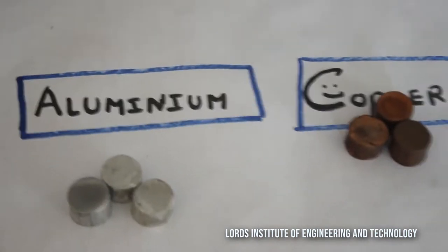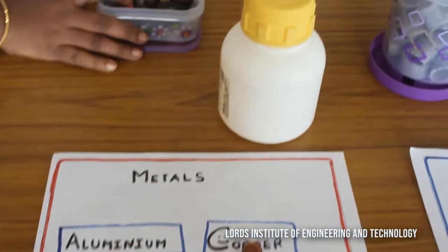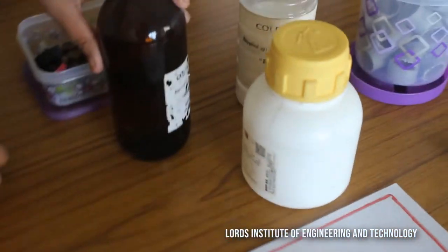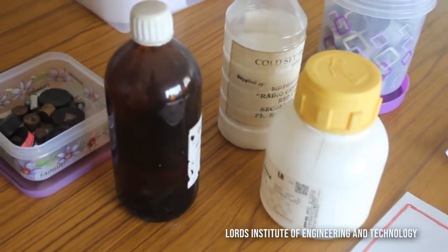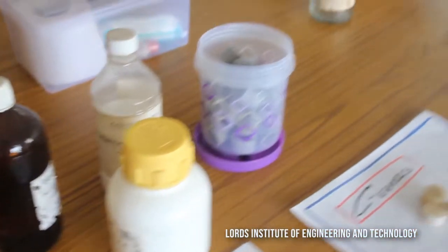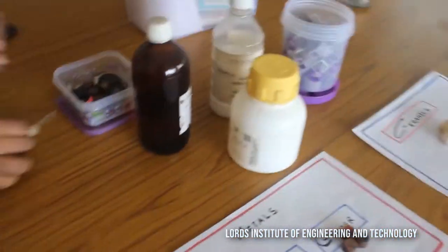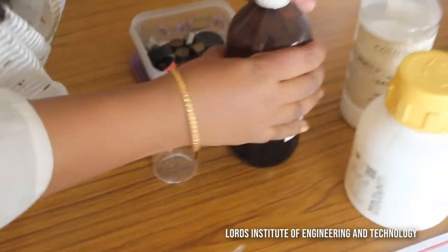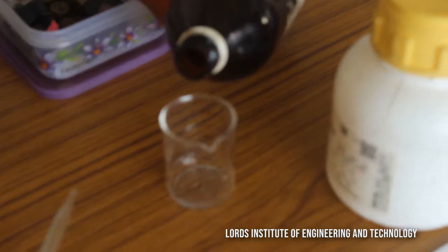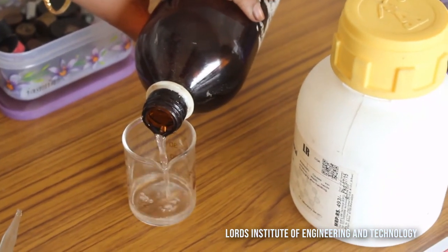This is your cold setting powder and this is your cold setting liquid. These two we are going to mix in a beaker in a proportionate quantity. Now we are going to mix the proportionate quantity — for example 10 ml or 20 ml — depending upon the shape of what we are going to prepare.